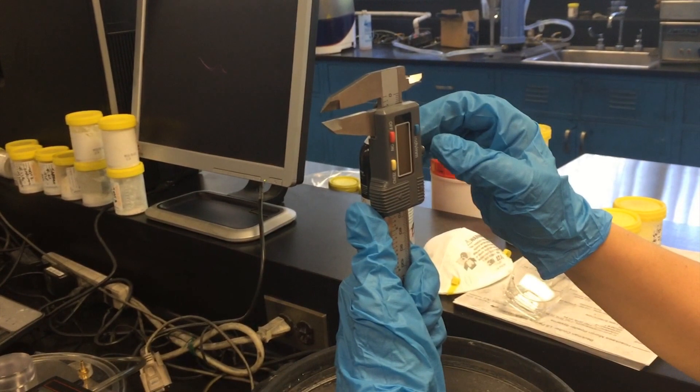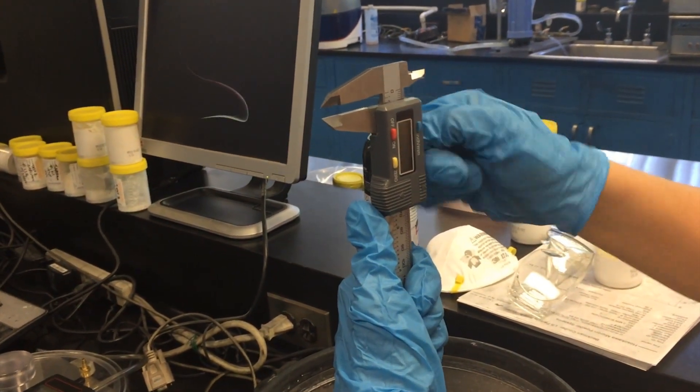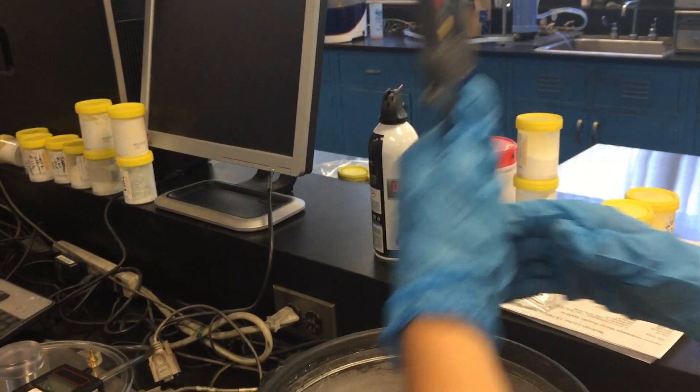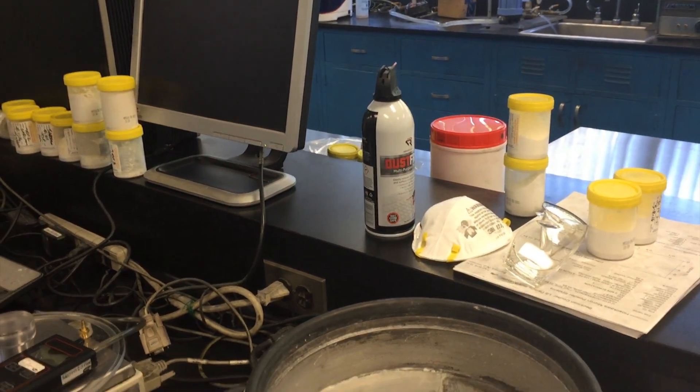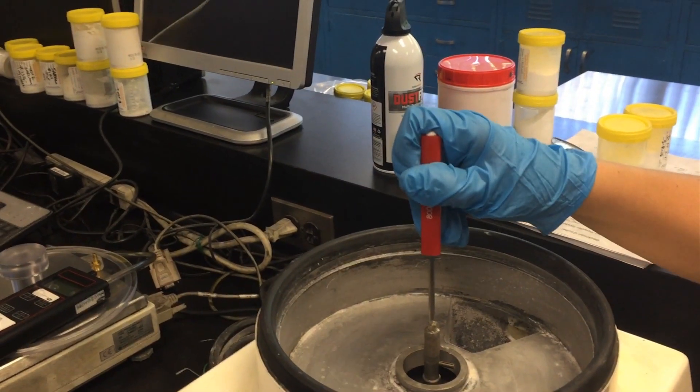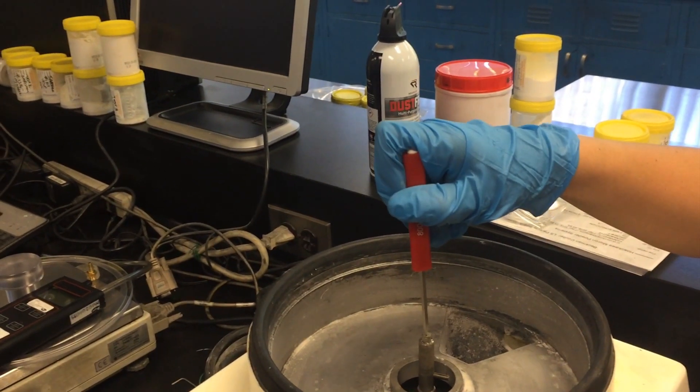As you can see here, it's reading 4.95mm, so we're going to raise it a little bit. In order to raise it, you're going to take a screwdriver and turn it ever so slightly.